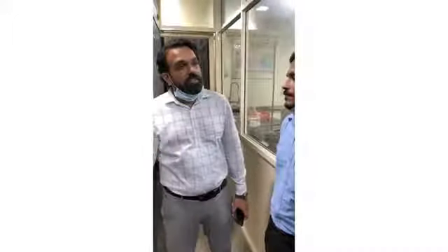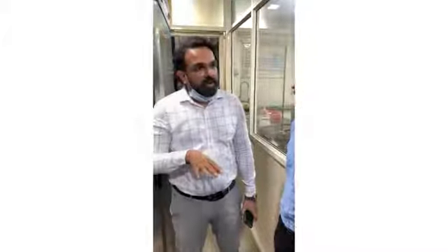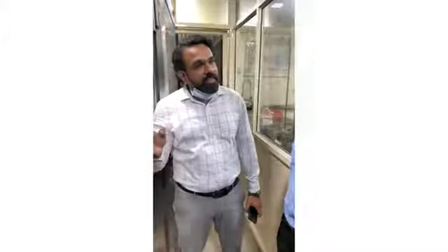So we will give high temperature and high humidity. High humidity means high moisture content in your air. So humid air would be there, temperature would be high, and then we will see what is the impact on my product. That we will conduct, and we will see whether my product is stable or not stable. This is the basic fundamental. On that basis, we define the shelf life or expiry date of my product. These chambers are meant for that purpose.